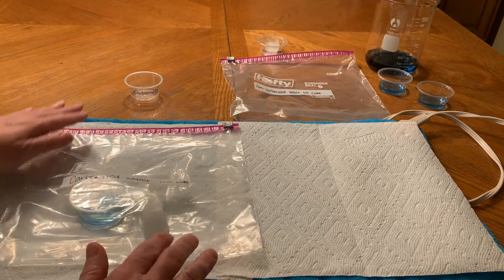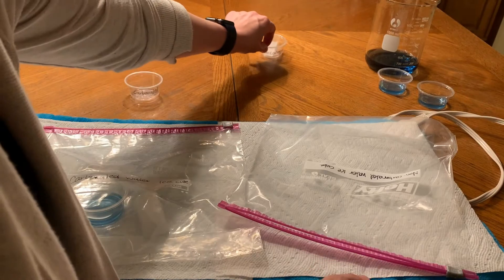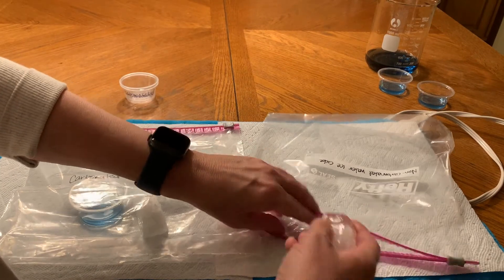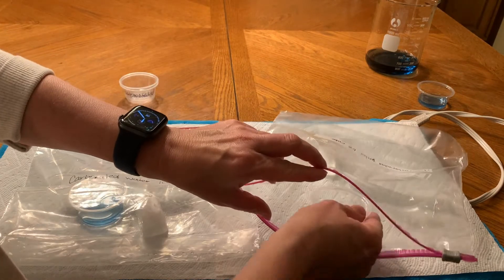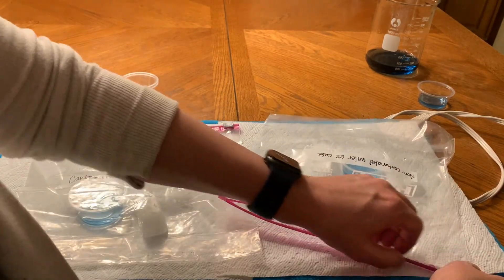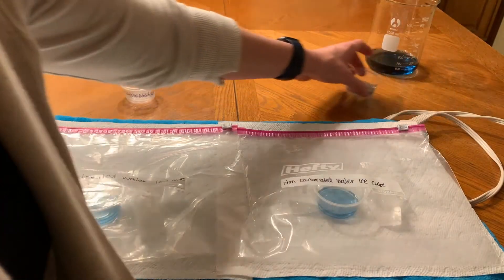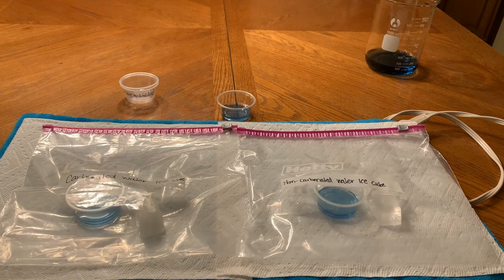If we leave it open, the gas might escape. In our second baggie, we have an ice cube made from non-carbonated water. We put that in the baggie with a second container of BTB and close it up. We also have a container of BTB out in the room as a control to see if it changes.